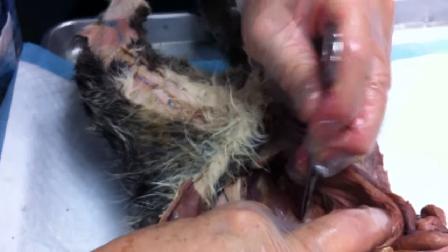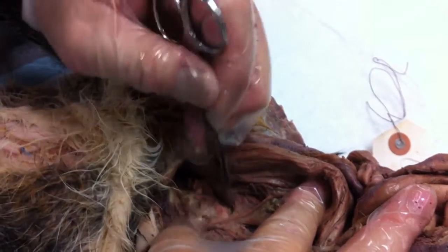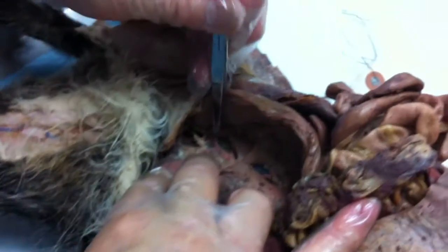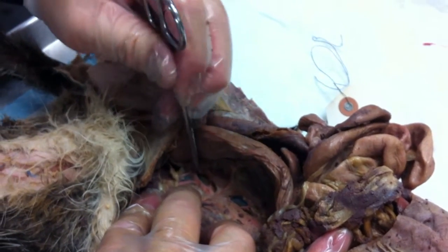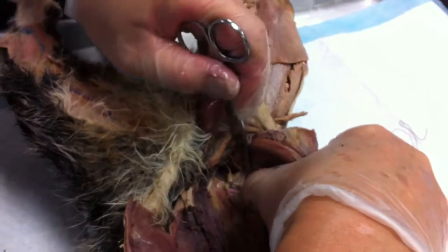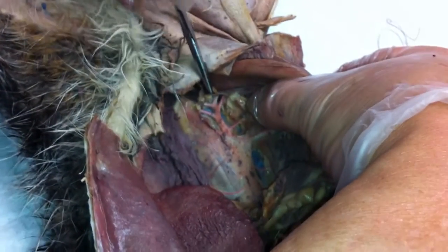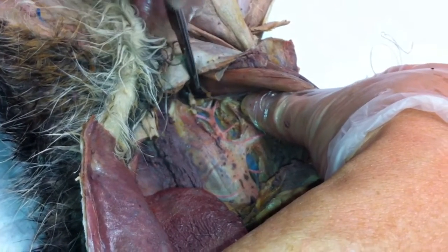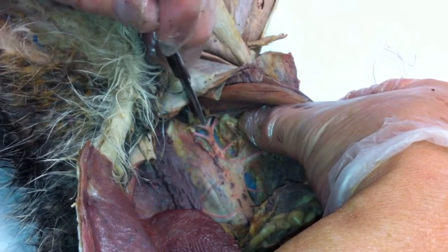That red vessel you see here is the abdominal aorta. There's the abdominal aorta — you see this and this. That's the external and internal iliacs.